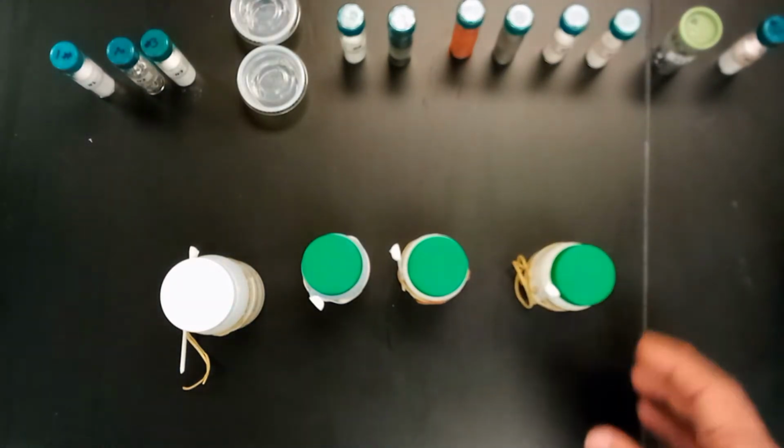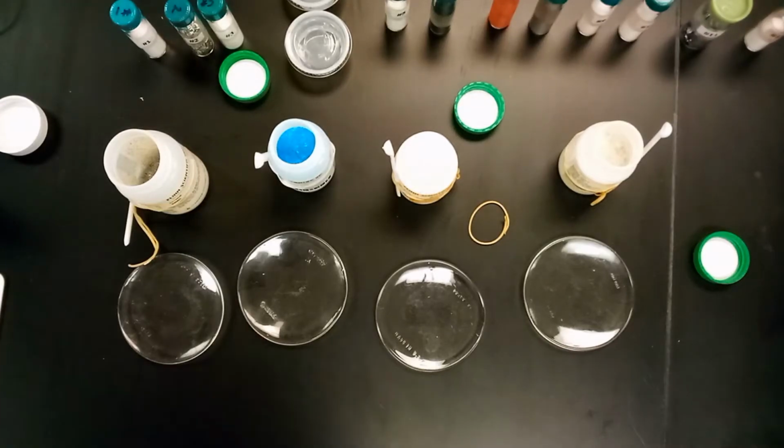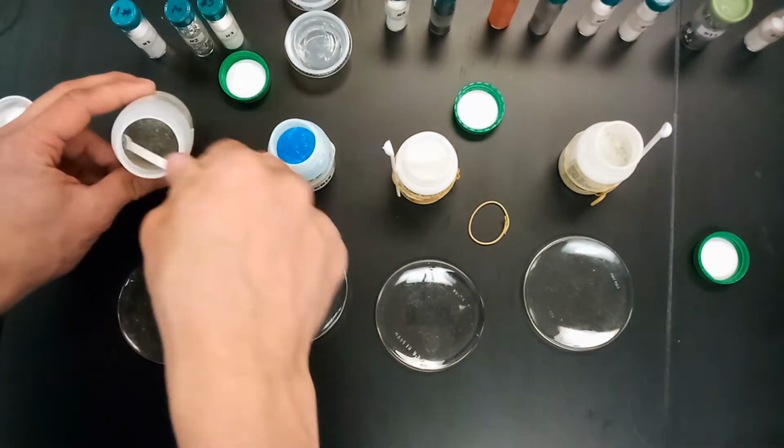So we have each of these, and we'll be testing some of the attributes for each, mainly the color and appearance, their solubility in water, hexane and alcohol, the melting point, their conductivity, as both a solid and solution, the pH of the solution, and whether or not they react with hydrochloric acid and sodium hydroxide. So here we are. We have 4 little stations to work with to begin with. So we're going to start here with the zinc over here on the left.